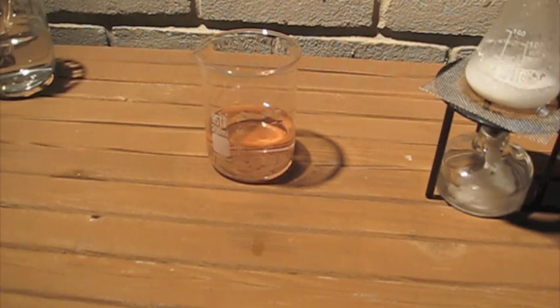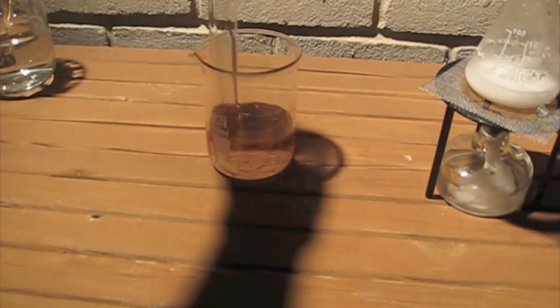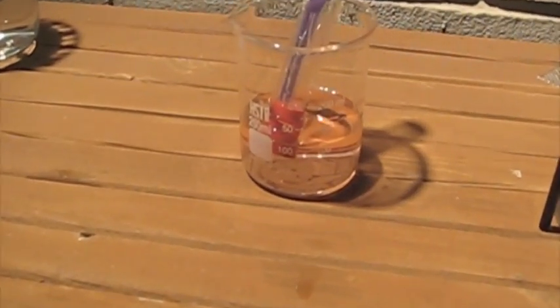I'm going to try this again. This time I got better results. Instead of getting a big splat, I got something with more fountain-like results.